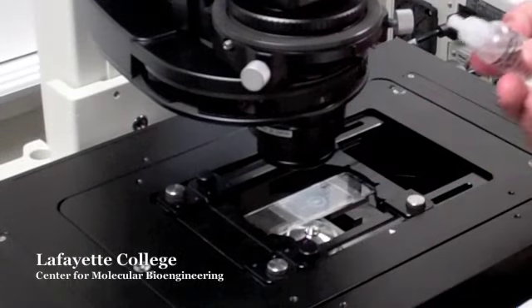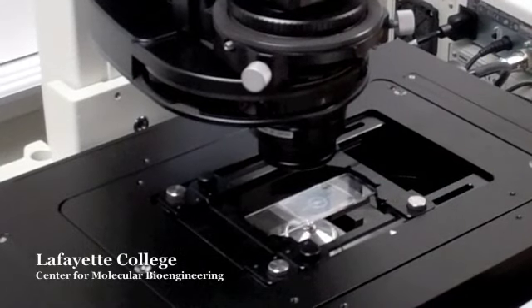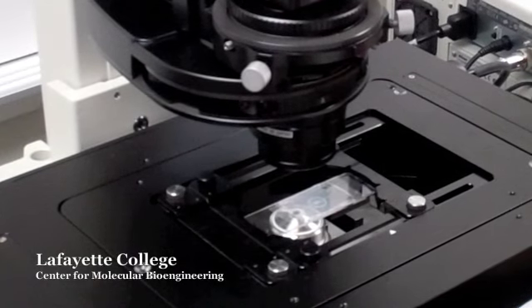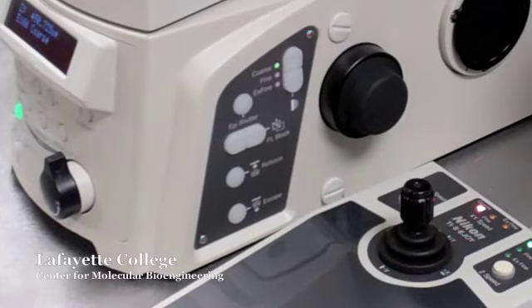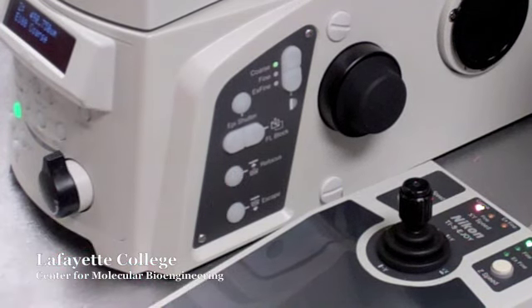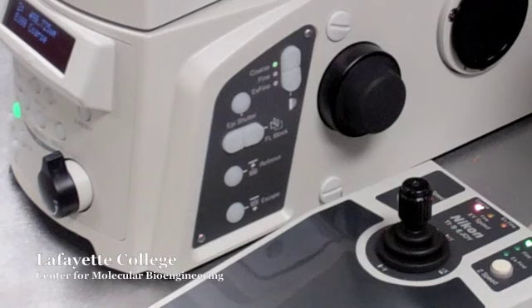If using the 60x objective, be sure to add a small drop of oil to the objective's nosepiece before refocusing. Once you have finished selecting your objective, press refocus on the right side of the microscope to raise the nosepiece back to the desired location.